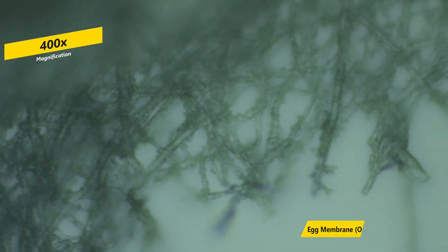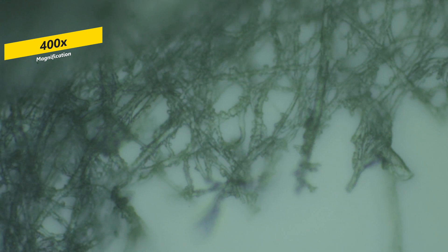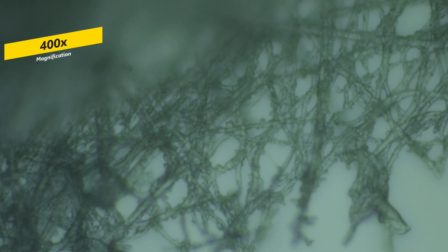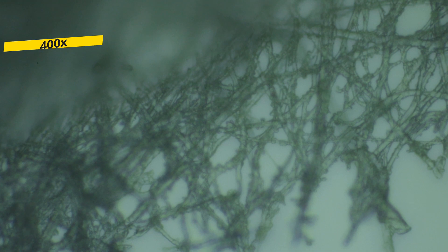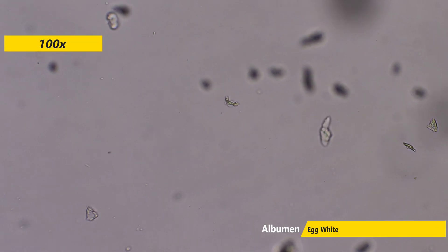You'll be happy to hear I didn't see any bacteria when looking at any parts of the egg under the microscope. And yes, the membrane is safe to eat. Let's look at the egg white.